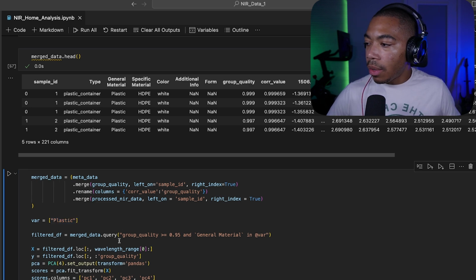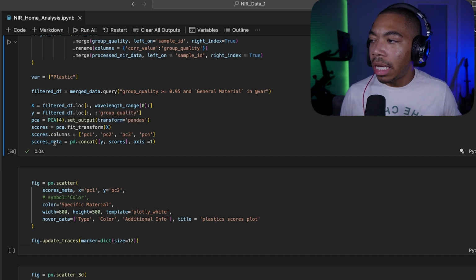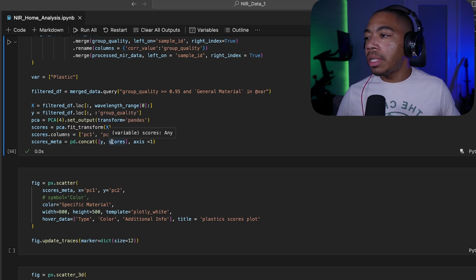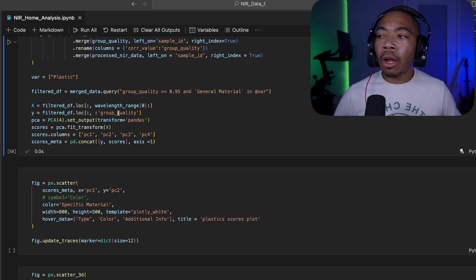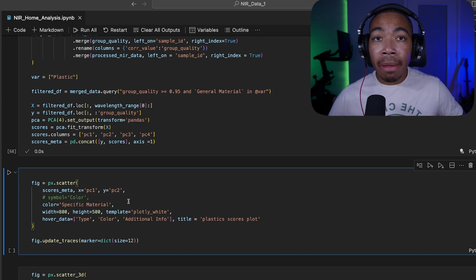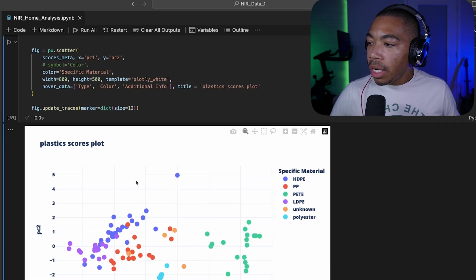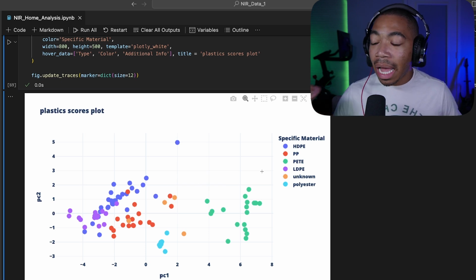Next, we will perform PCA and create a new data frame called scores meta, where we're going to take our scores data and merge that with our metadata. So this will allow us to understand more about our materials. And lastly, finally, we're going to create a scatter plot so we can begin understanding the impact of our data filtering.